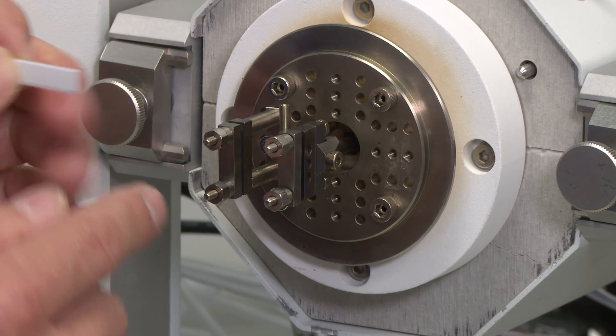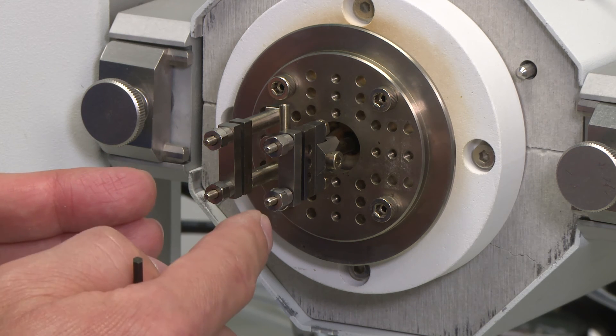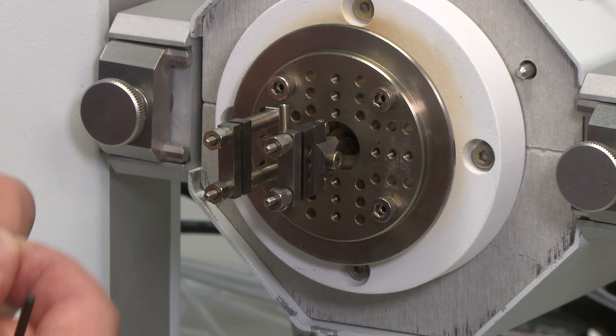Also, you can adjust the distance between the fixed pillar and the drive shaft to accommodate for the sample length.